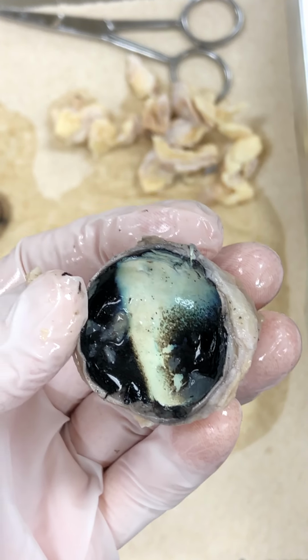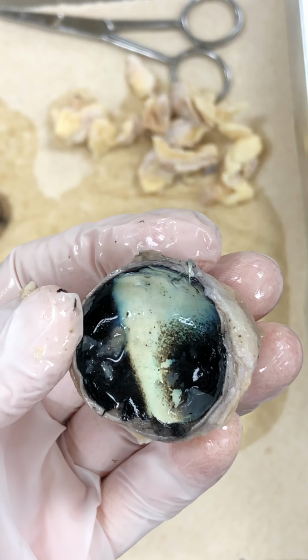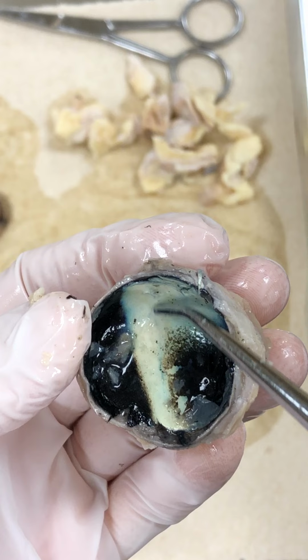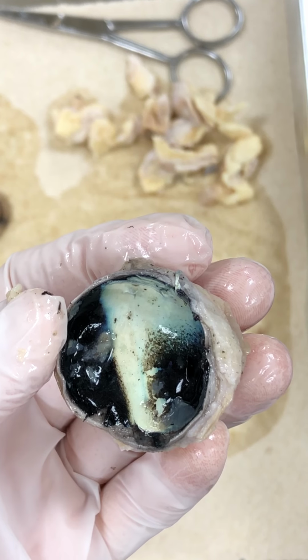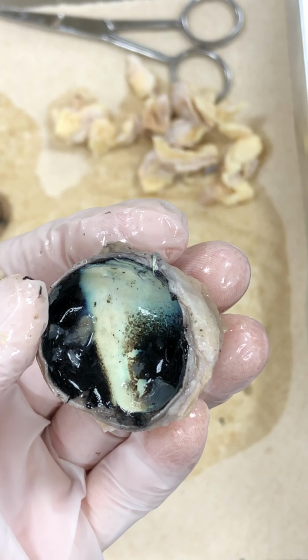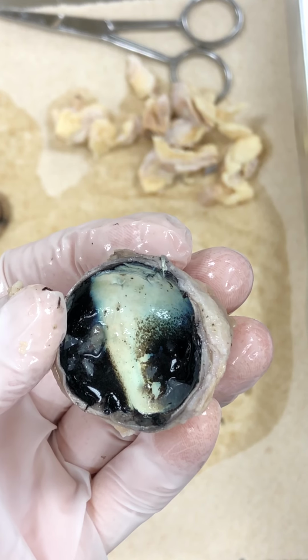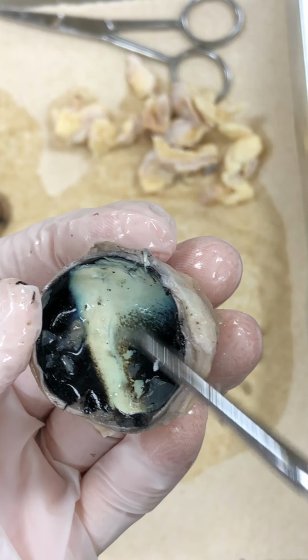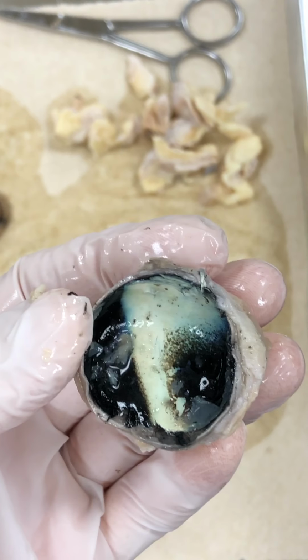Remember how we talked about how humans can see a little bit in dim light, but we really can't see well in darkness because we're relying on our rods. And we don't have this thing called the tapetum lucidum that animals that are nocturnal have. They can see at night. So if you've ever shined a light into your dog or cat, or if there's a deer on the road, deer in headlights, it stops in your headlights, it almost reflects back a yellow or a green or an orange. It's different depending on the species of animal because their tapetum lucidum is slightly different in each species. So because the tapetum lucidum is embedded in the choroid layer, our entire choroid is just black. Okay, lots of pigment there, no tapetum lucidum.